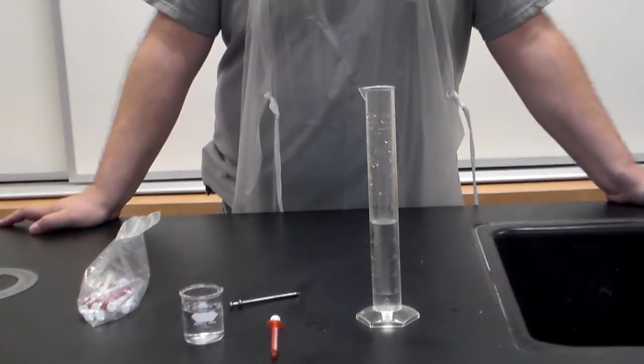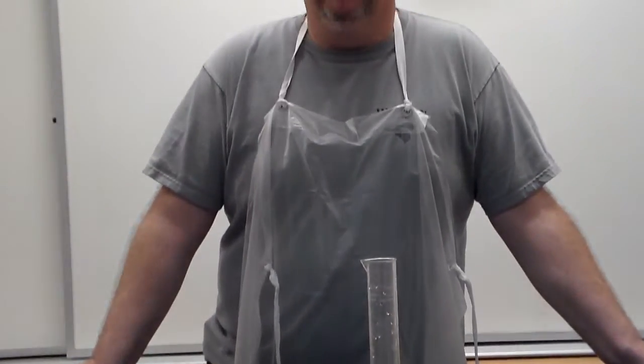You've seen me in such fine quality epic chemistry videos as Density, It's So Dense, and Are Things Really More Dense Than Water and Still Float? Today we're looking at the first AP Chemistry lab dealing with density.